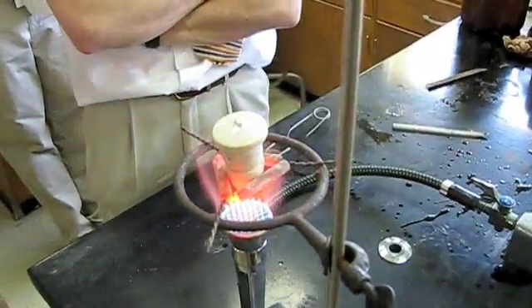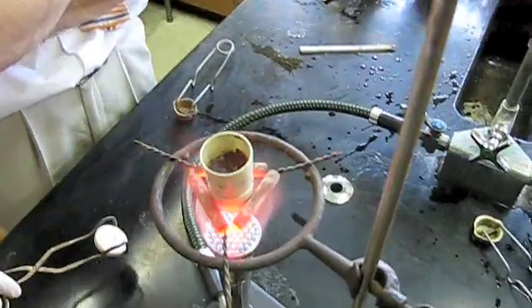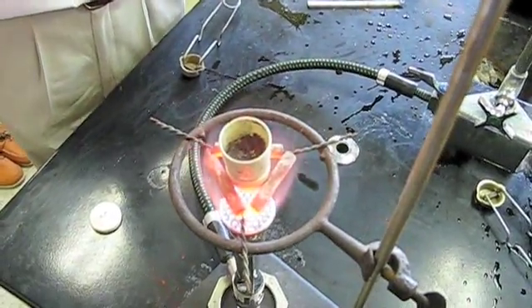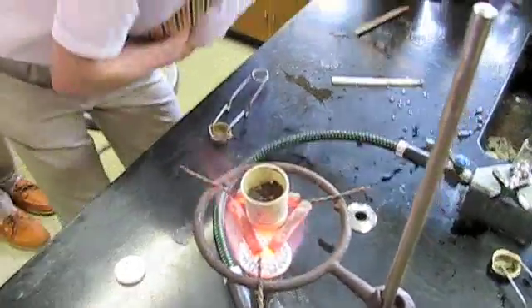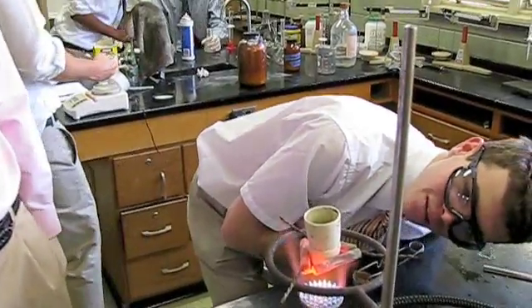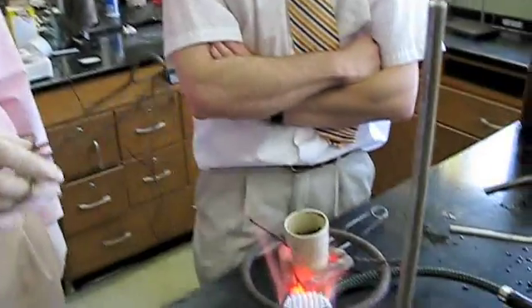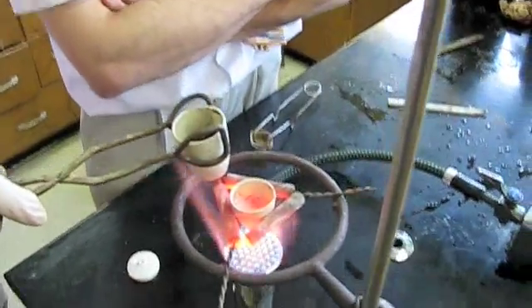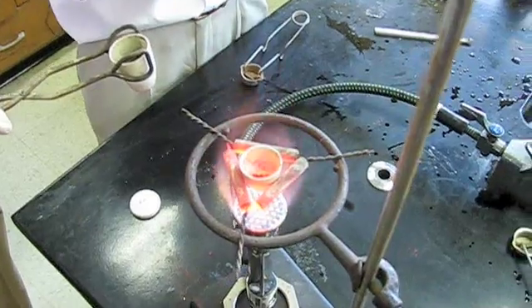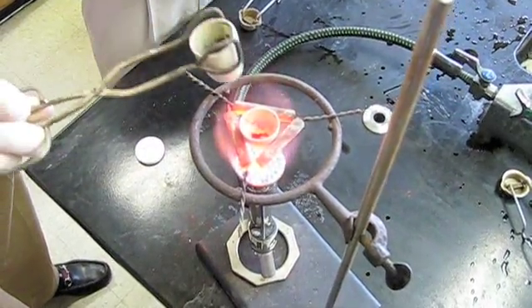Very cool. Let's see what it looks like with the lid off. Gently. Looks like we have some black formation possible — iron formation. It still looks like charcoal. It shouldn't take too long. There might be some forming in the bottom there. I guess we'll see. Do you think it will drip down? That's what's supposed to happen. There's some steel forming in there. There's some iron. Go ahead and put it back. Now we wait.